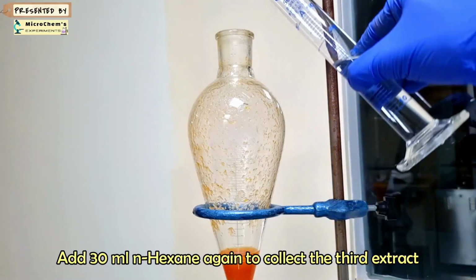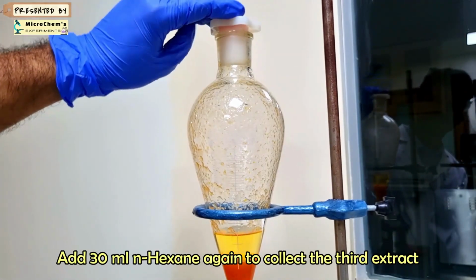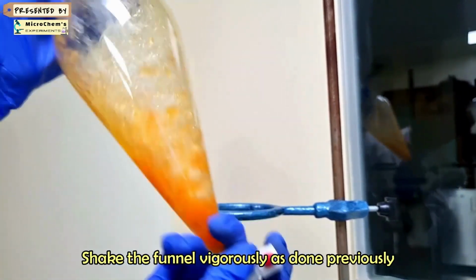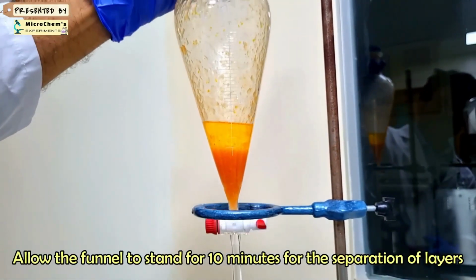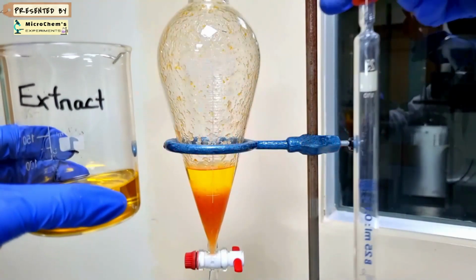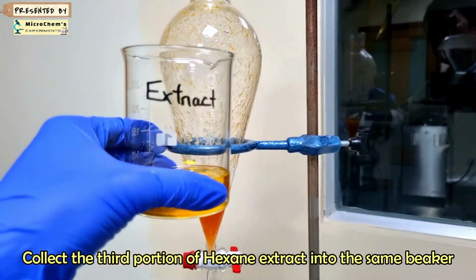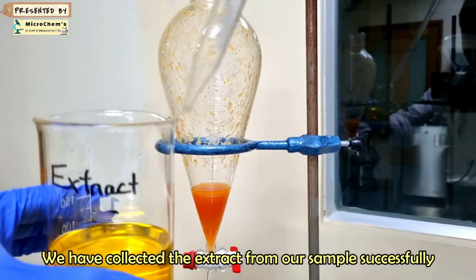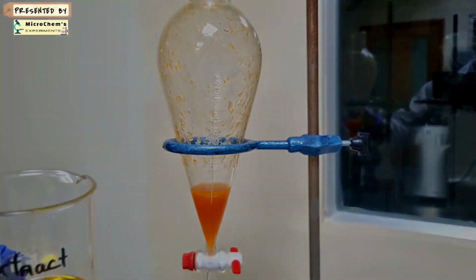Add 30 ml of n-hexane again into the separating funnel and shake for 2 minutes. Allow the funnel to stand for 10 minutes for the separation of layers. In the same way, collect the third portion of the hexane extract and combine together. Concentrate the sample extract to about 10 to 20 ml using a rotary evaporator prior to cleanup.